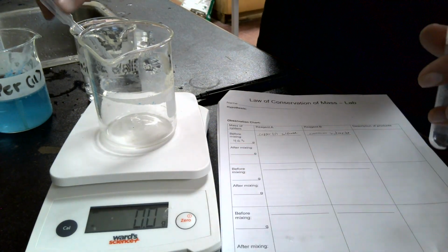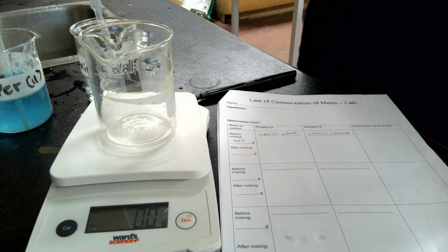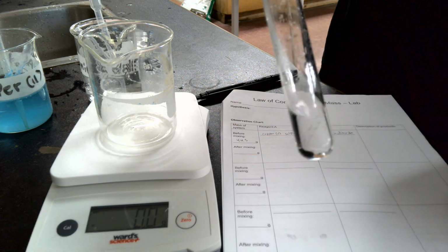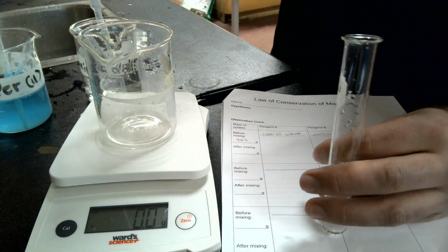And then you've got your ammonium hydroxide. I'm going to put that in the big test tube. So here you've got your ammonium hydroxide. Some people say it's a bit pink in color. I don't honestly see it, but I am colorblind, so it's hard to say. But it's a thin liquid, kind of like water, pretty indistinguishable from water. You can take a smell of it. It does smell just a little bit of ammonia, but not really too much. Neither of these liquids really have much of a smell.